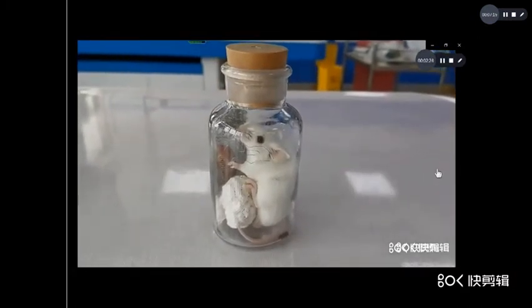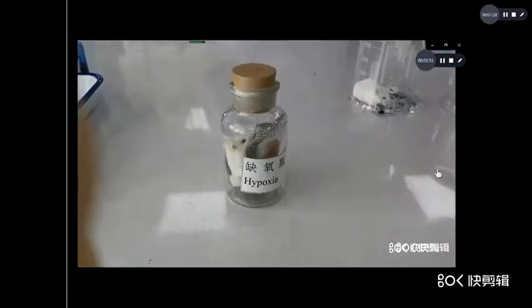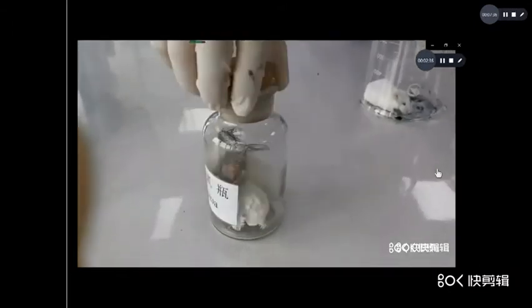You find respiration first increases and then decreases. Color of skin is bluish. After about half an hour, the mature mouse died.